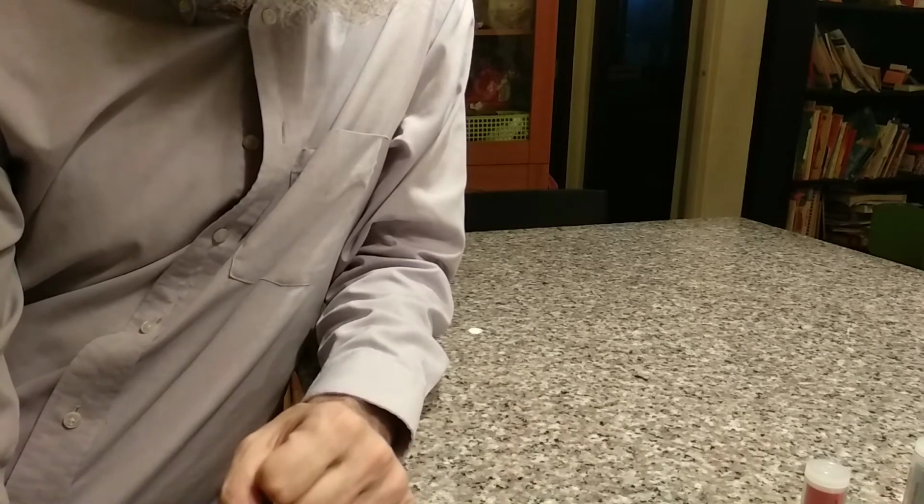But that doesn't mean, oh, this is just dilute, forget about it. I don't need to clean that off. I'll clean it off sometime when I'm washing up after my lab. It is a strong acid. Every one of those active ions in that solution is going to react with your skin.